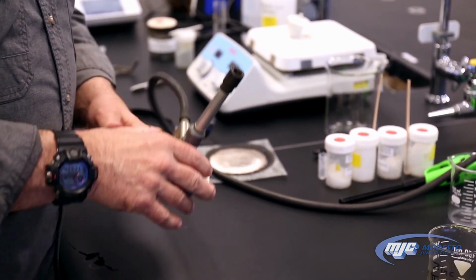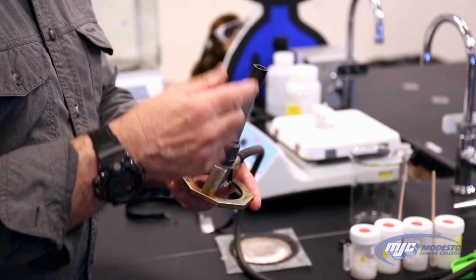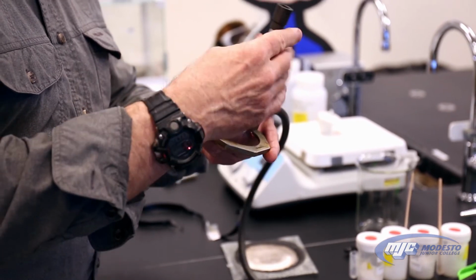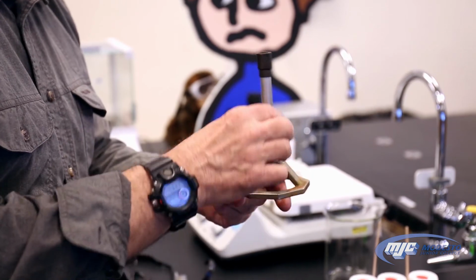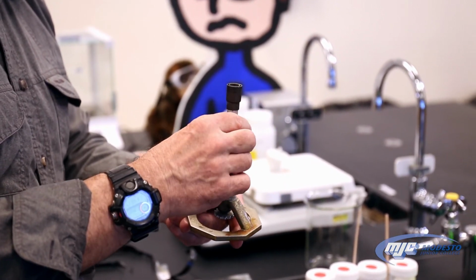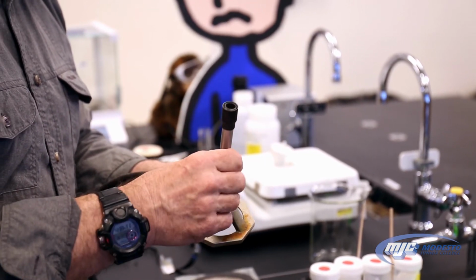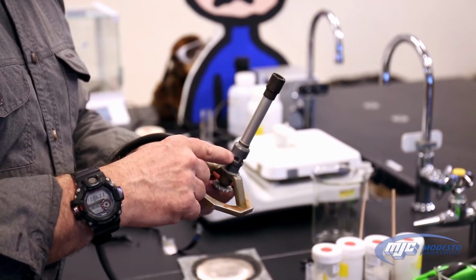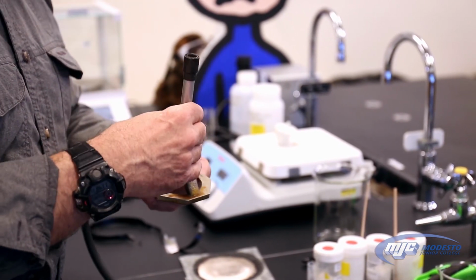And the last control, the third control, controls how much oxygen, which comes from the air, gets to the flame. And that's this little gap at the base of the column right here. Now, we control that gap by opening or closing this. This also, by the way, will come off. That's not a big deal, because if this comes off, the flame goes out. However, if this is open too far, there's too much oxygen and the flame keeps blowing itself out and you can't get the thing lit.